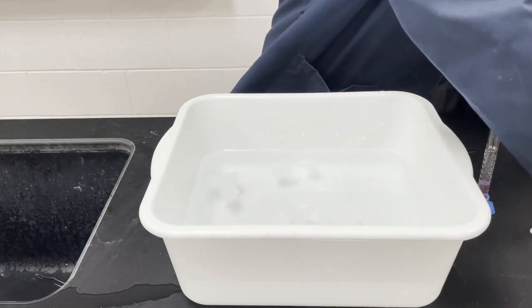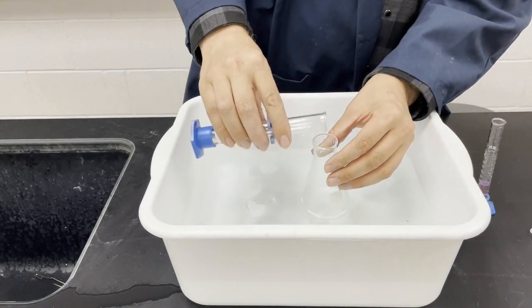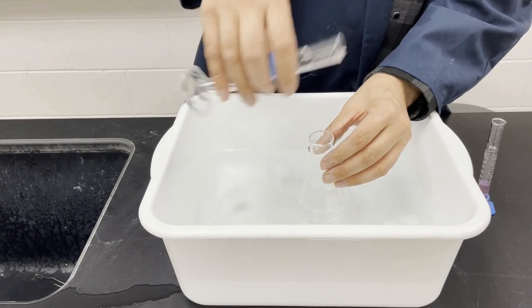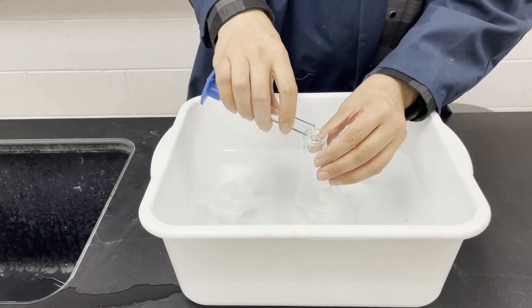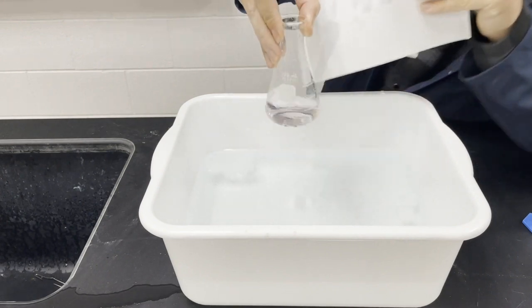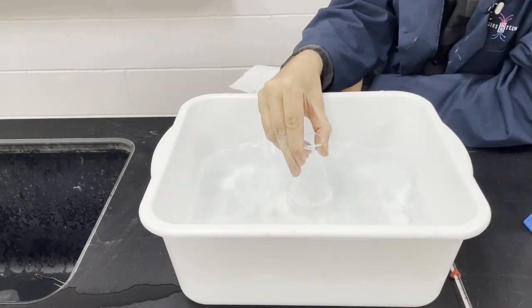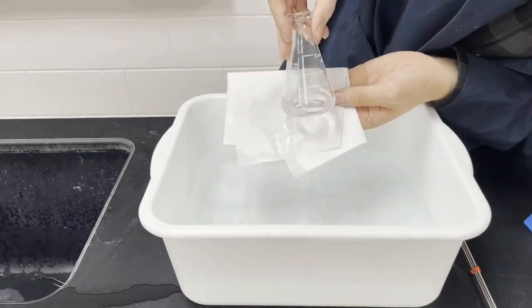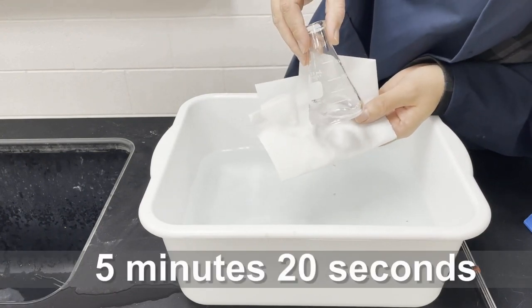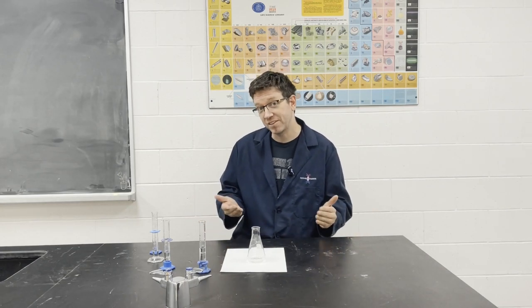Let's start it. I think finally, I think we're good. There we are.